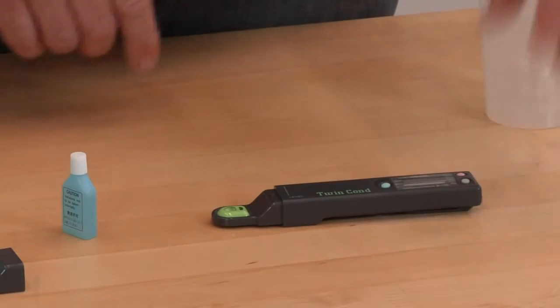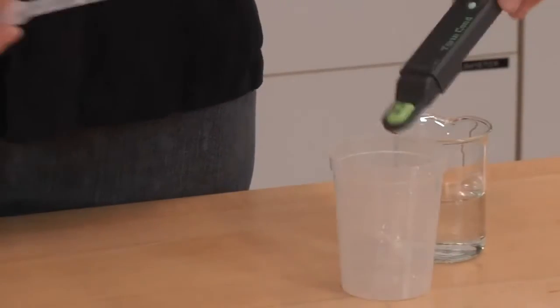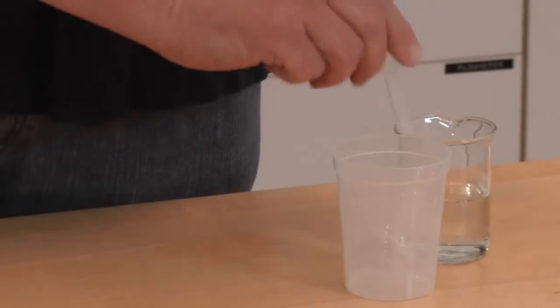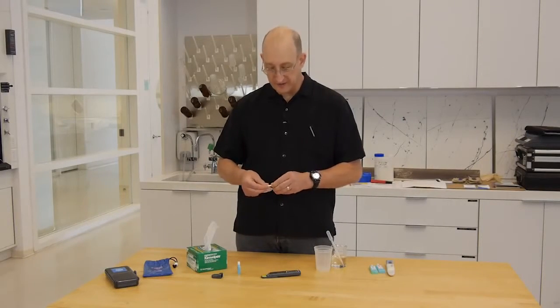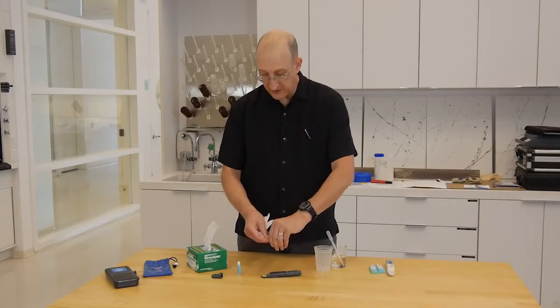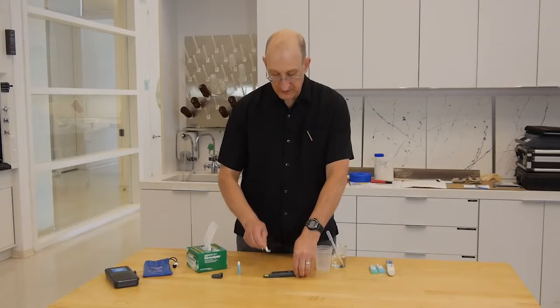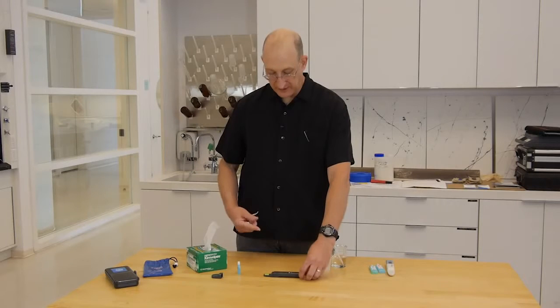So we have our happy face. We then rinse the electrode head with deionized or distilled water, and just flush it out. Because dilution matters for conductivity meters, we want to make sure we always dry the sample well with a little piece of Kim wipe to get the water out, so we don't dilute our next reading.